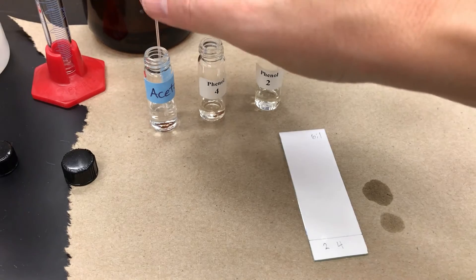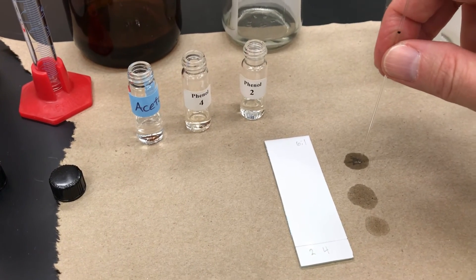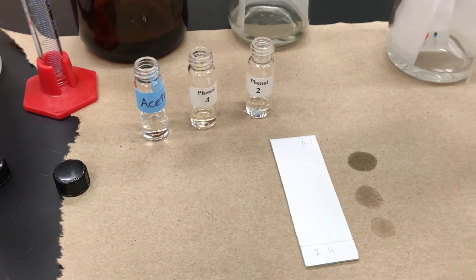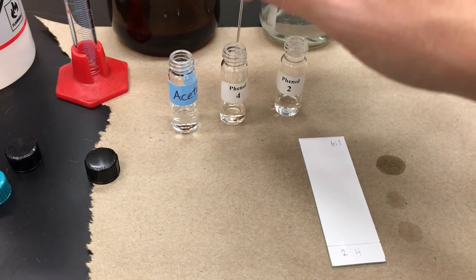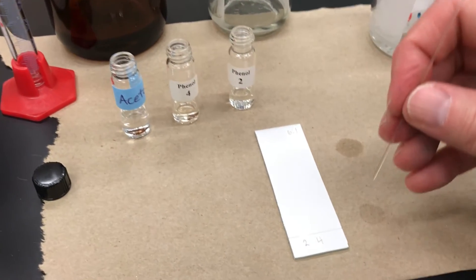I'm also going to rinse with acetone in this case, just because it's different than the food dyes. But I do that a couple times. And notice everything drains a lot quicker when it's using acetone and different solvents.